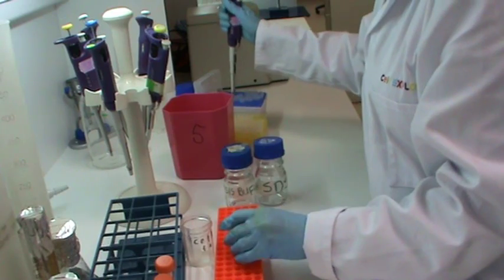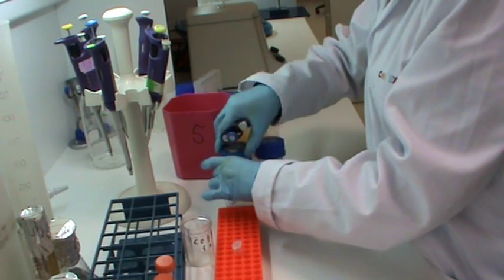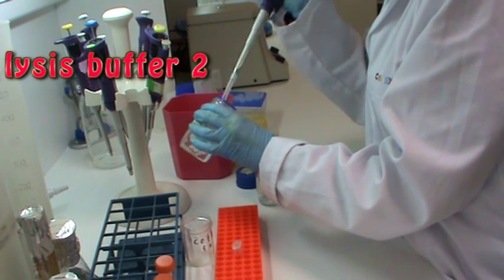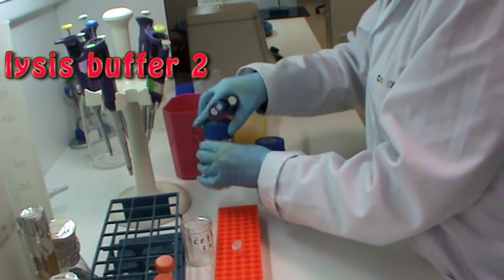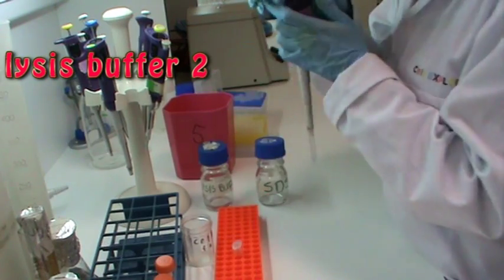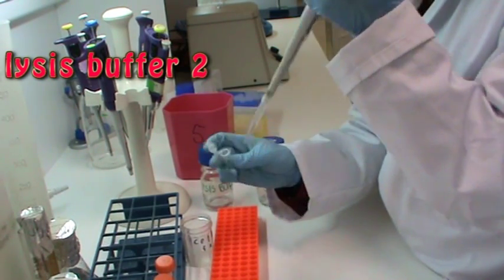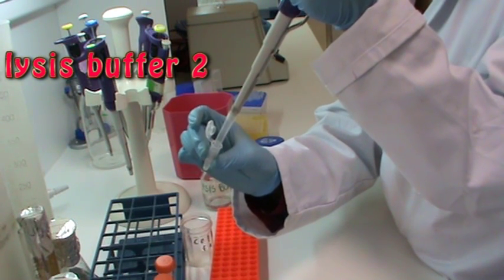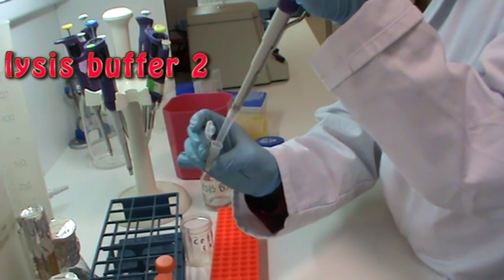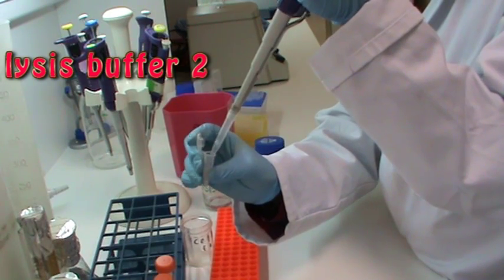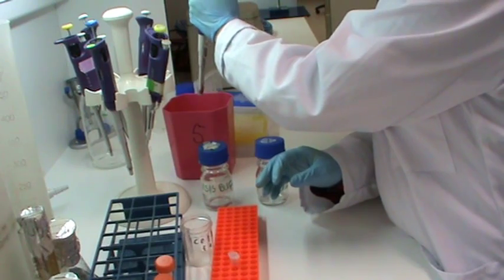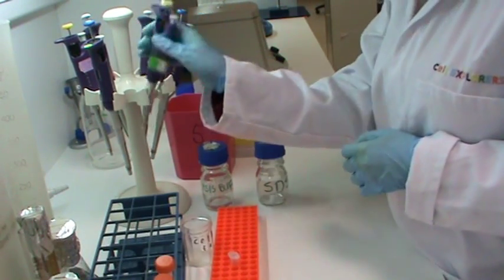To break down the cellular and nuclear membrane, I have first resuspended the pellet in lysis buffer. Next I am adding SDS.